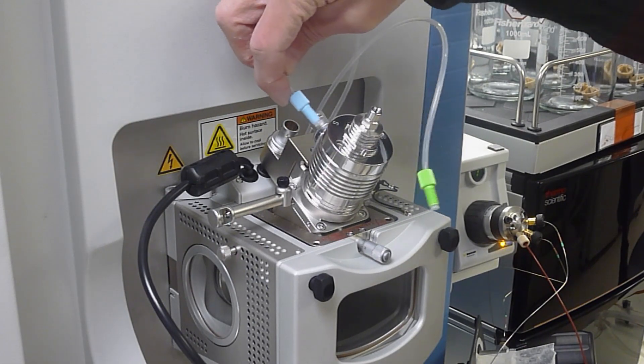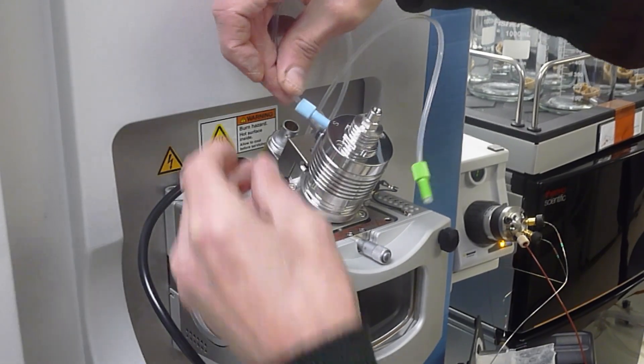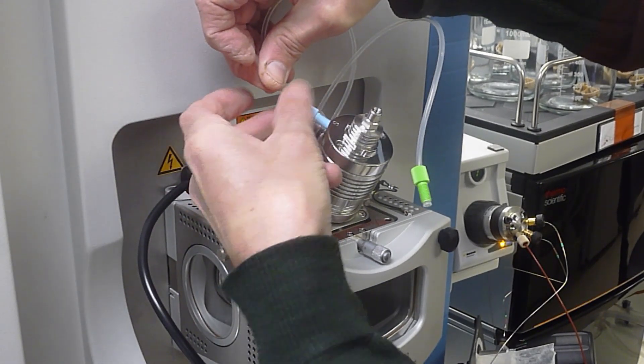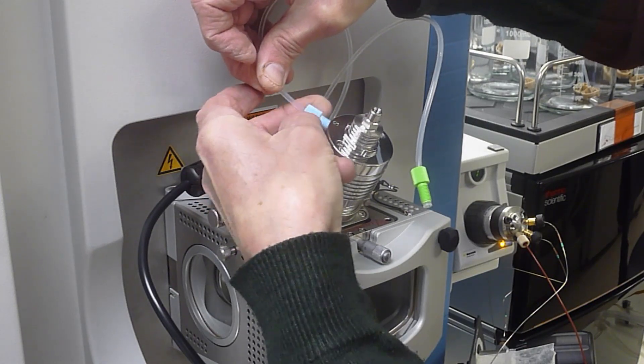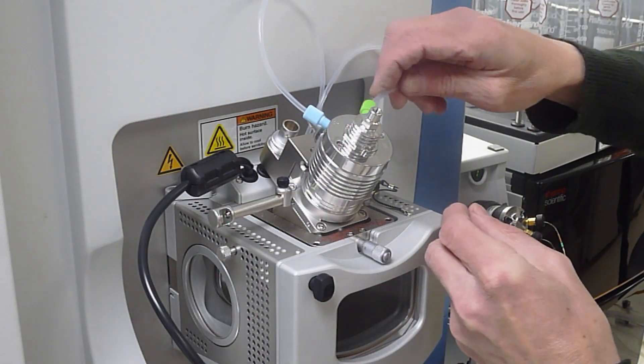Then replace the blue and the green gas lines. Try not to get the gas lines cross threaded.